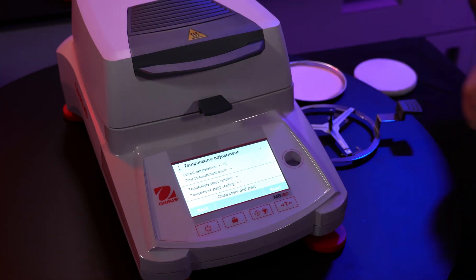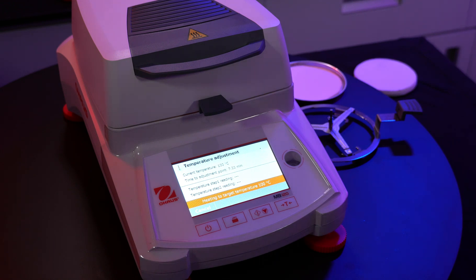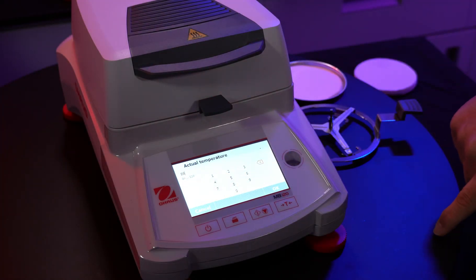Hit next and hit start. The temperature will now be calibrated at two set points: 100 and 160 degrees Celsius. Both tests will take 15 minutes to complete, and once completed, you will have an additional 15 minutes to input the temperature reading of the calibrator by looking through the vent on the top of the lid.